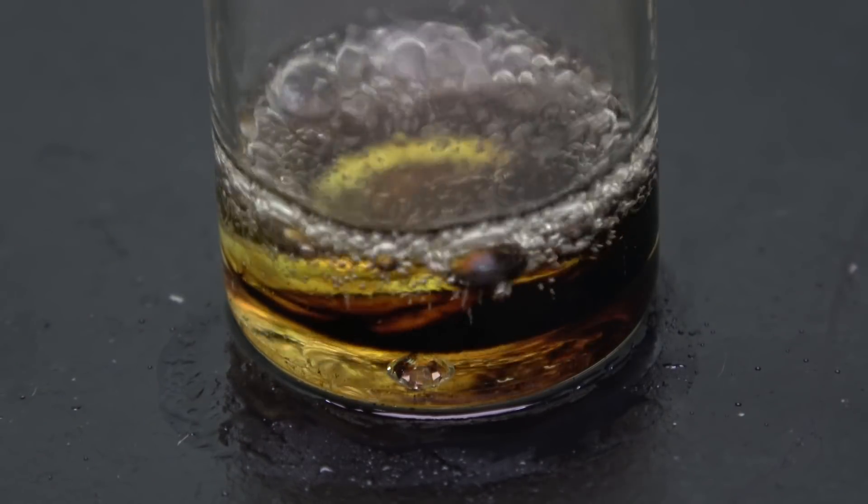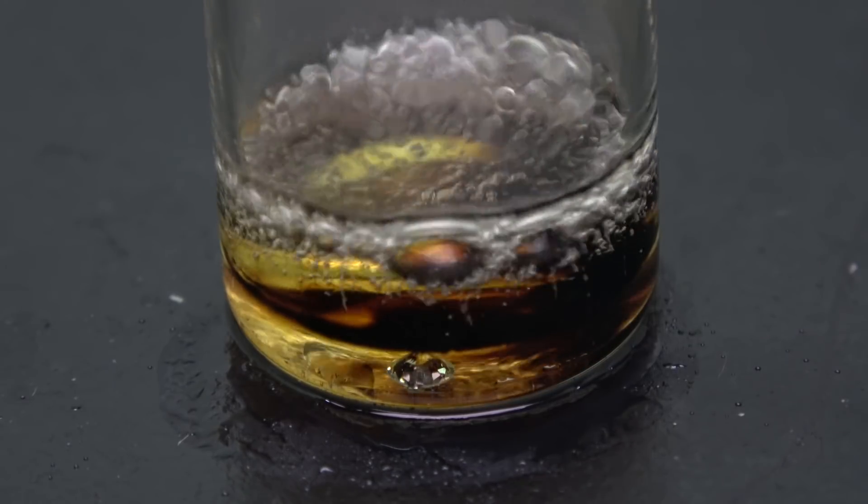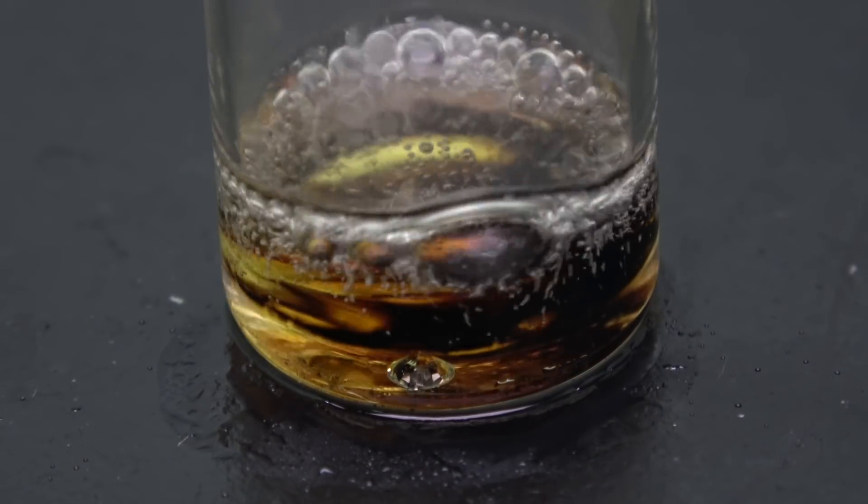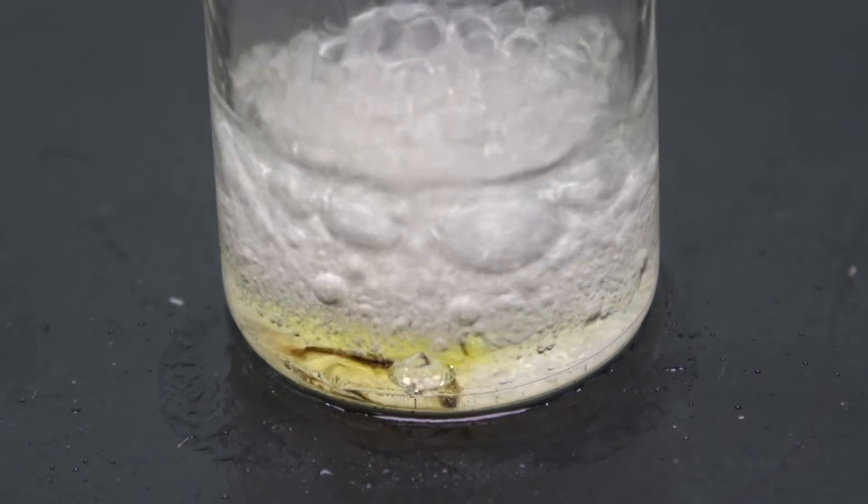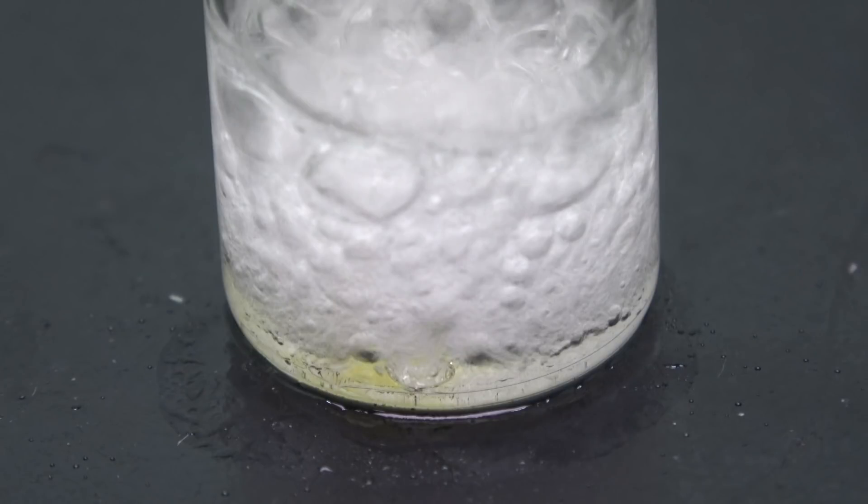Okay, at this point, I guess you are all wondering what is going on with the diamond. Let me stop you right about here. As you can see, all the black carbon from the glucose is gone at this stage.